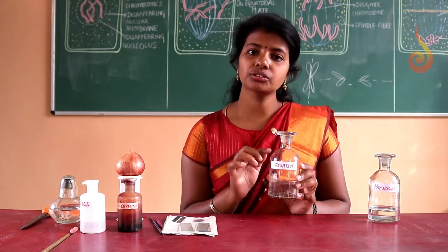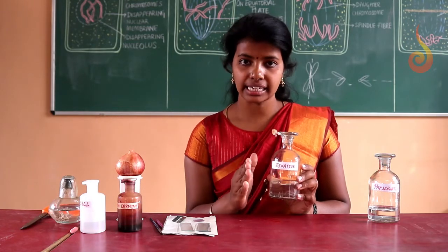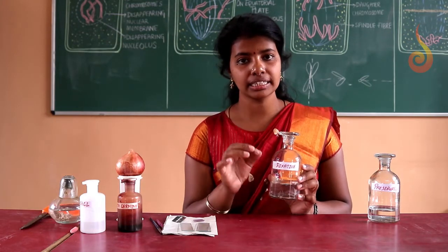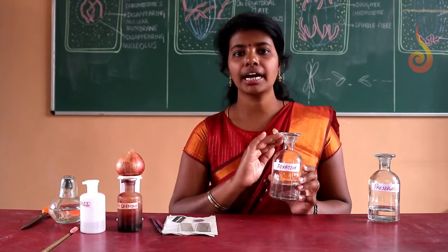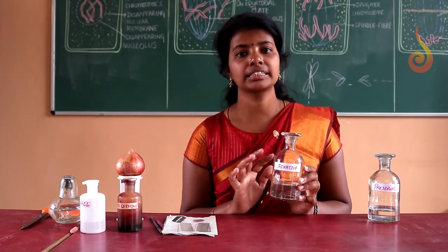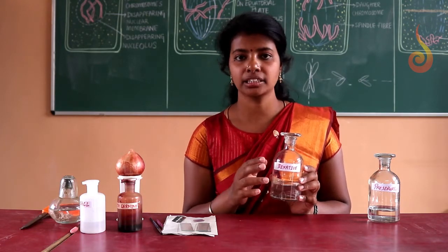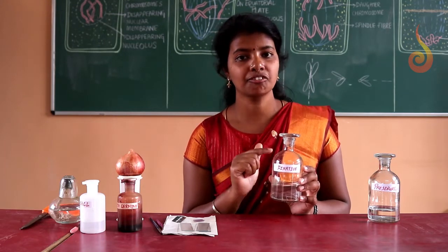The purpose of using fixative is that we have to arrest the cell in the stage in which it is. For example, I want to study the metaphase stage and the anaphase stage. Randomly, I don't know whether the cells are in metaphase or anaphase, but we have to arrest them in metaphase and anaphase. So early morning 6 to 8 is the right time to cut the onion root tips, and then we have to immediately put them in the fixative.